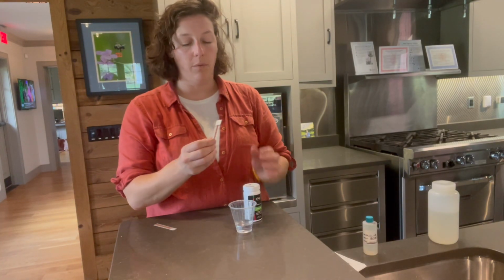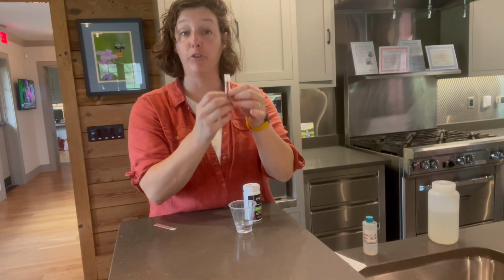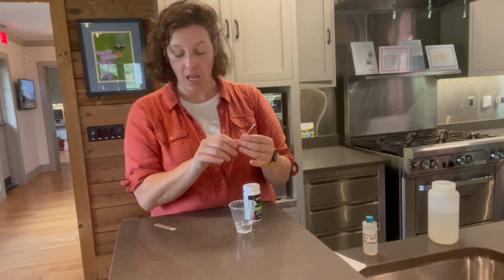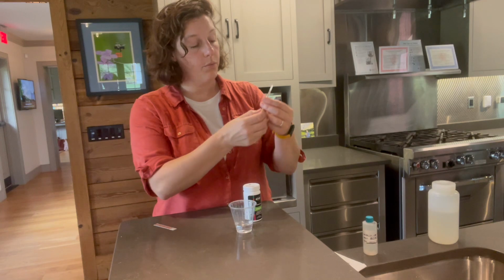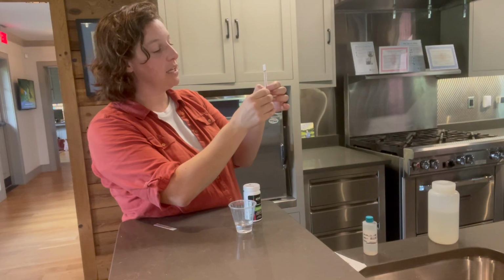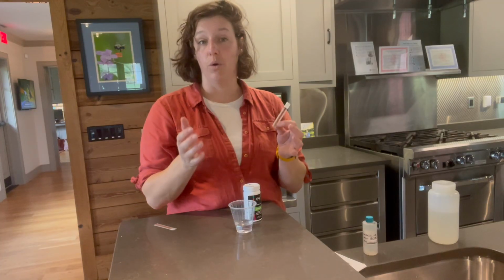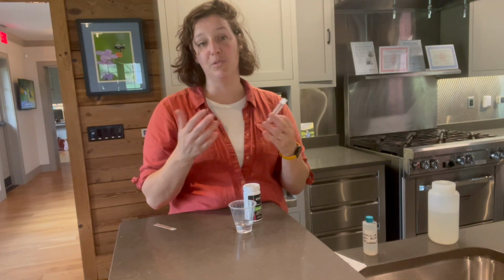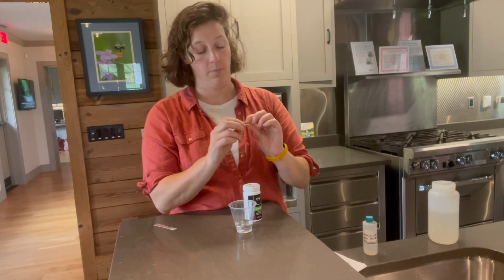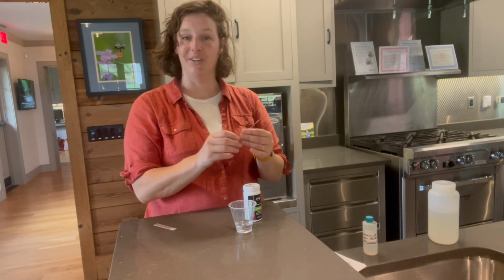It's very important that we make sure two things. First is we want that black bar to be fully black all the way across to ensure that water has wicked all the way up the test strip. And second, when we're taking a peek at our peak, we want to make sure that we're counting the number that the actual point crosses. We don't round up or down or guess if it falls between two lines. We want to know the exact number that the strip is displaying. So once you record all of that on your data sheet, you're good to go.